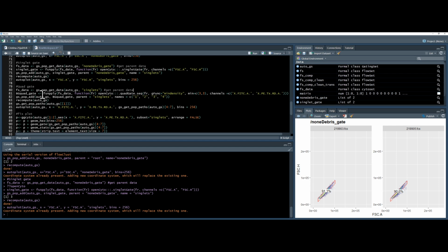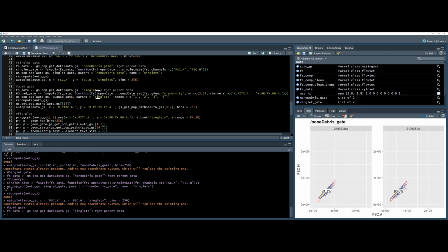Okay, let's do a quadrant gate. So again, we're going to get the data from singlets this time. Then we're going to create a quadrant gate, fsApply, function, OpenCyto. There's 2 quadrant gate commands, quadrant gate sequence and quadrant gate tmix. Look at the documentation. Sequence wants a function for how to work out where the breakoffs are, and I'm using min density today. And I'm using a minimum of 3 and 3. So I know this already because I did a run through and there were issues because there were so many negative numbers that it was confusing the quadrant gate. So I did a little bit of troubleshooting and used this min command, and I'm using the channels FITC-A and PE Texas Red, which I think is CD3 and CD4.